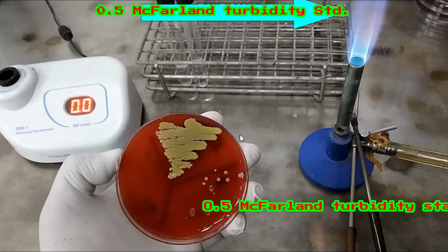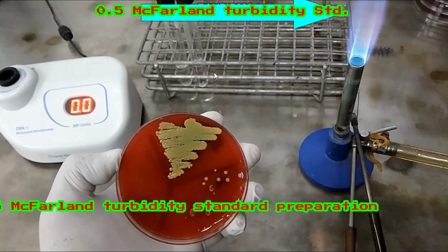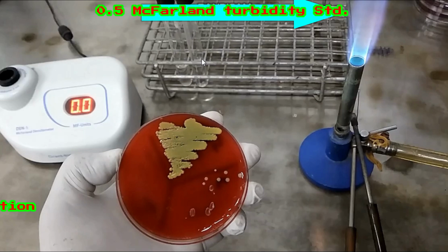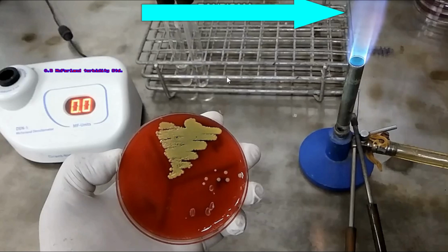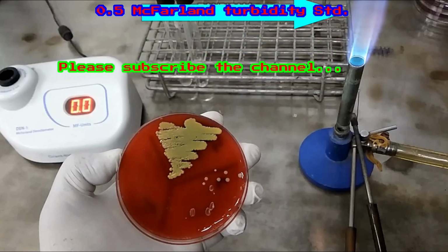Hi, today we concern with how to make 0.5 McFarland turbidity standard without using of sulfuric acid and barium chloride.